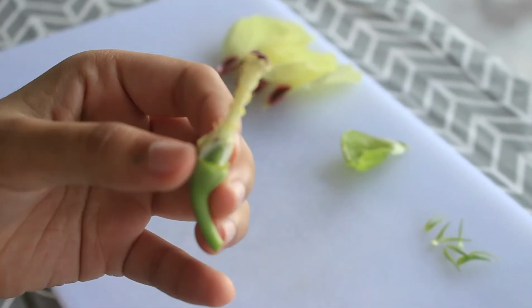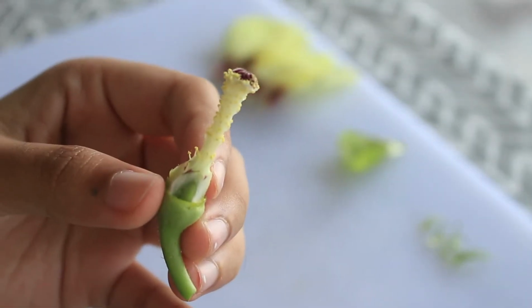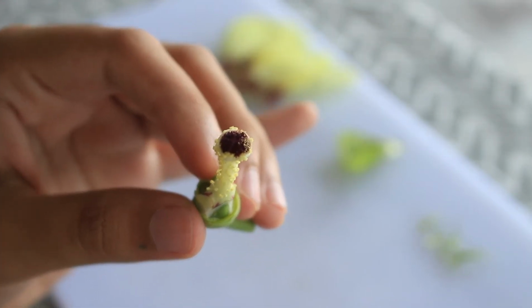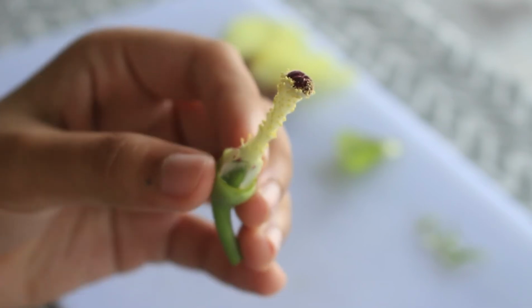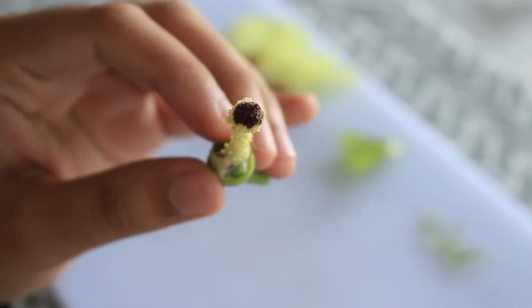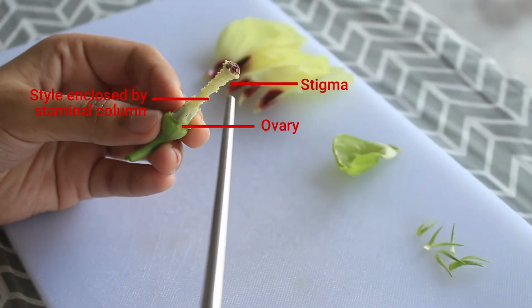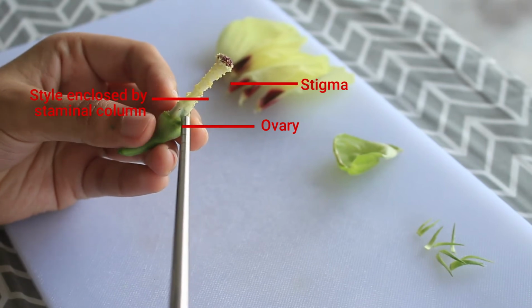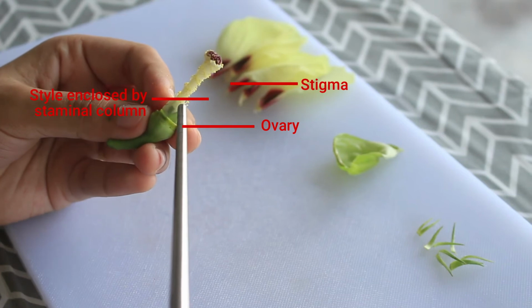Now, what is left here is the female reproductive organ, which is pistil, and the male reproductive organ, which is the stamens. So this is the stigma up at the top, and attached to it is the style enclosed with staminal column, and down here is the ovary.